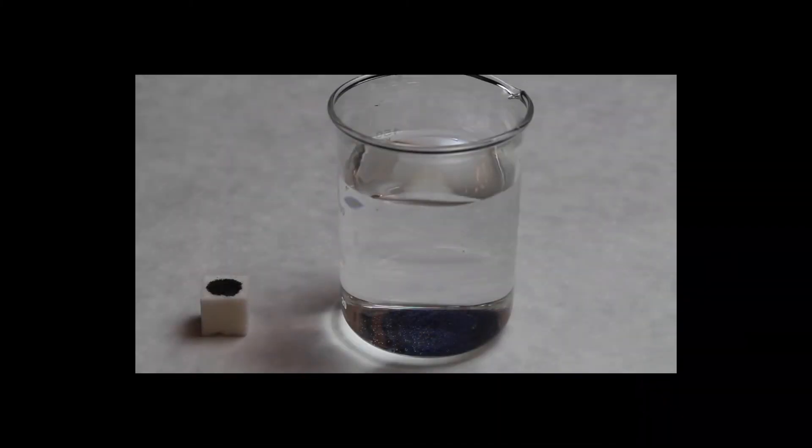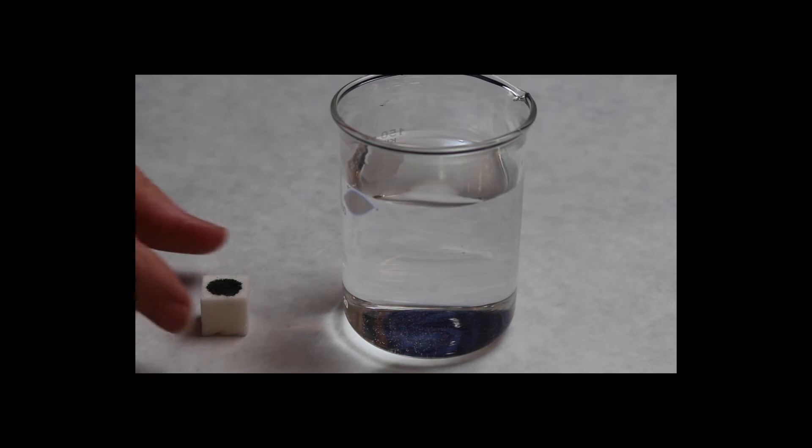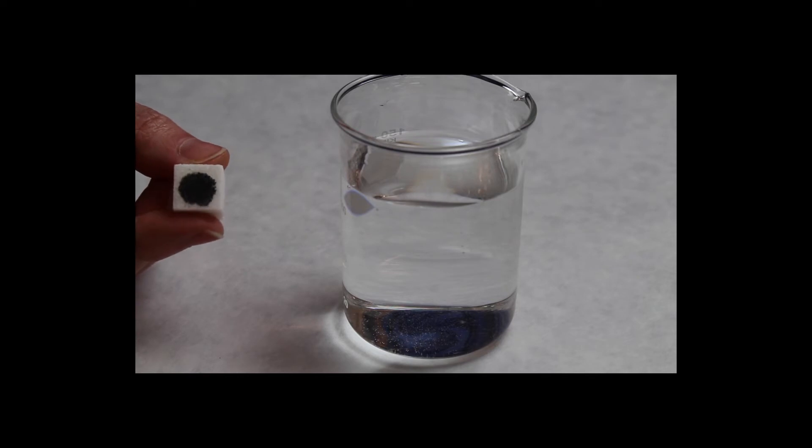This demonstration is about solubility, which is dependent upon both polarity and intermolecular forces. We have a beaker of water and a sugar cube with a circle that has been placed on it using pencil lead.